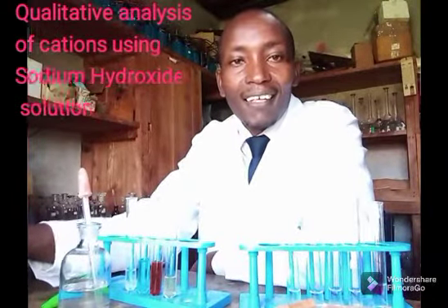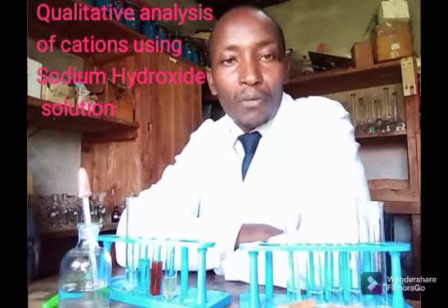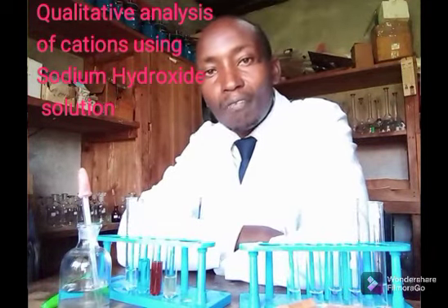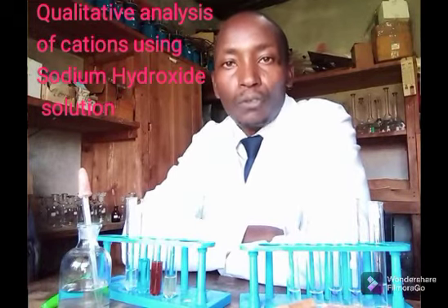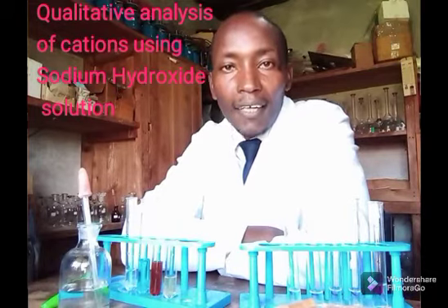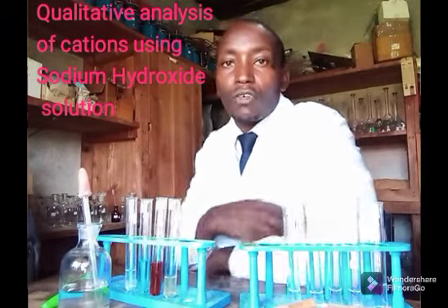Hello students and welcome. I like keeping my promise, and I promise to bring to you the qualitative analysis of cations using sodium hydroxide. In my previous video, I took you through what happens if you add aqueous ammonia to solutions containing metal ions. So for today, we want to analyze the 9 cations I had before using sodium hydroxide.